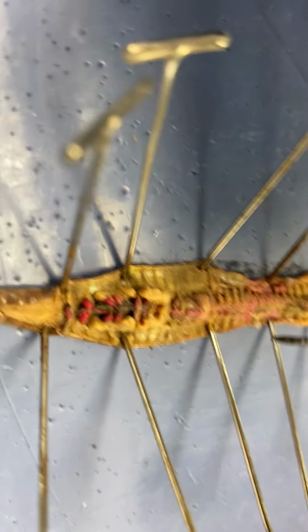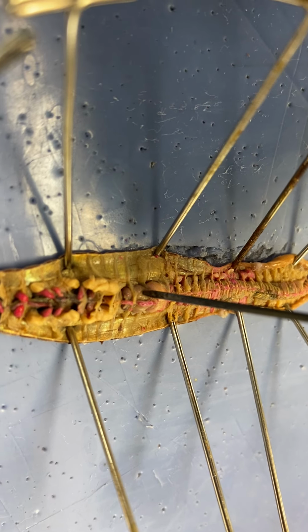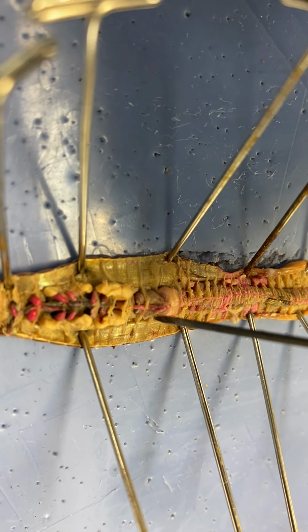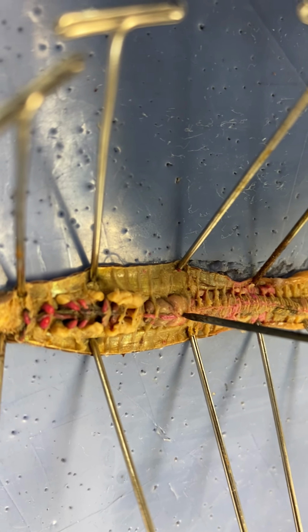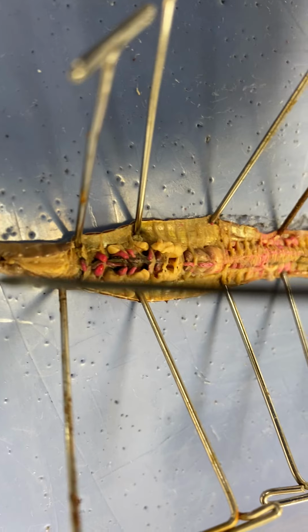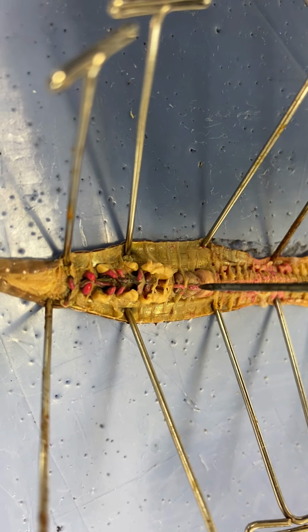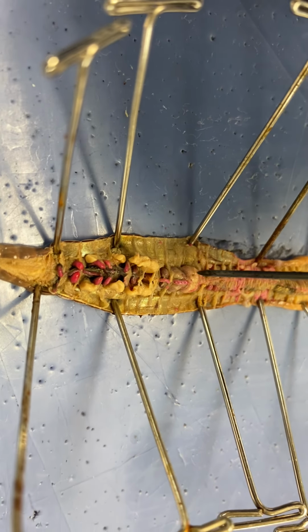Then the next part of the digestive system, these are 2 new structures. We have the crop and the gizzard. So this pouch is softer. So this stores the food. That is the crop. This one is harder and more muscular. This one's called the gizzard, and is used for grinding up the food. So mouth, pharynx, esophagus, crop, stores food, gizzard, grinds up food.